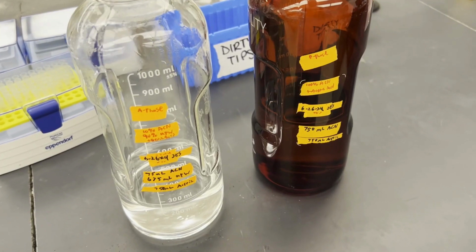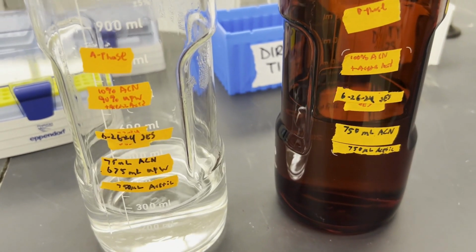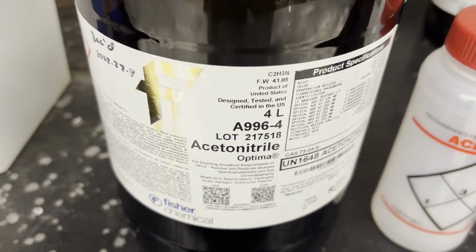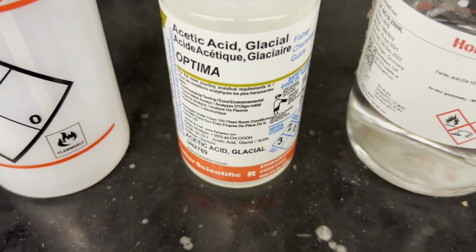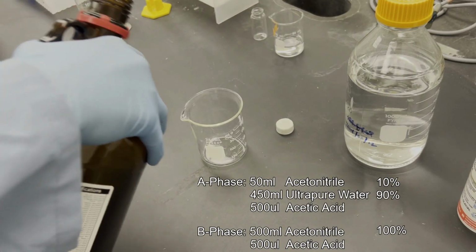Our mobile phase is up first. As this analysis requires a gradient, we will have an A phase and B phase eluent. Our B phase will be 100% acetonitrile, while our A phase is 10% acetonitrile and 90% ultrapure water. Acetic acid will be added to both to enhance separation and avoid ionization.